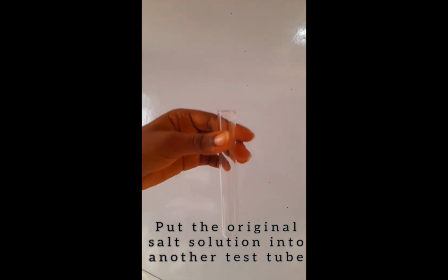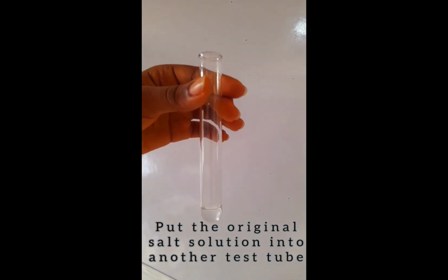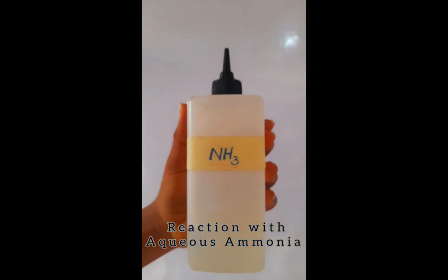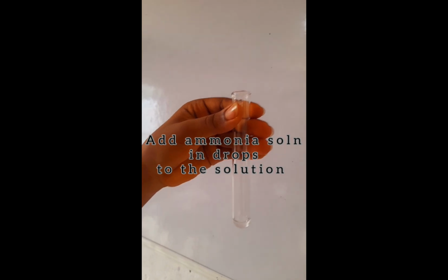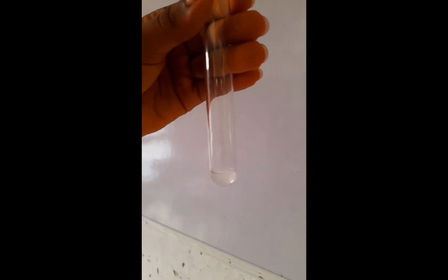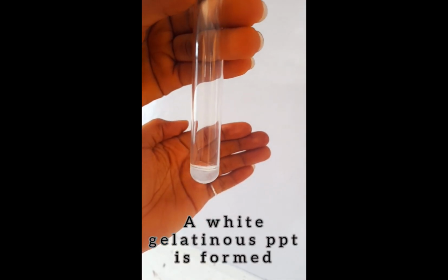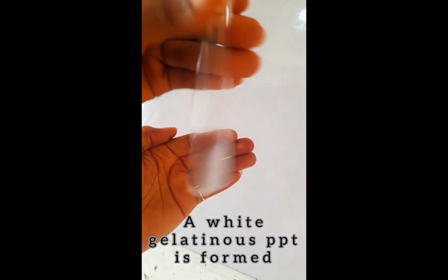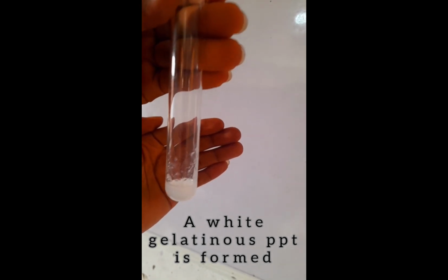But the next one in our table here is the test with ammonia, NH3. So we take the other portion of the solution of salt that contains the zinc ion, and then we react it with ammonia. Remember, our table says ammonia in drops first. So if we add ammonia in drops, you see the white gelatinous precipitate formed also. You can see it clearly now. You see, it sticks to the wall, so it's gelatinous, gummy or pap-like.